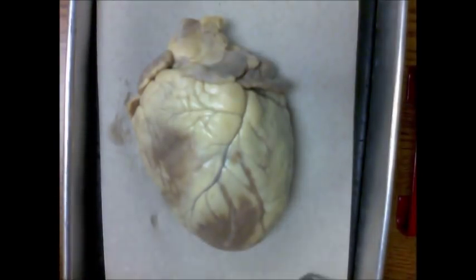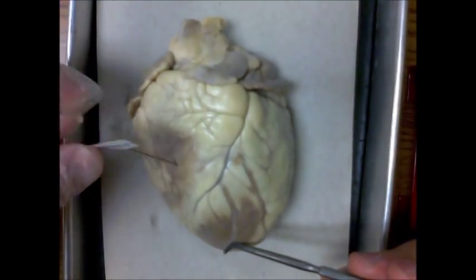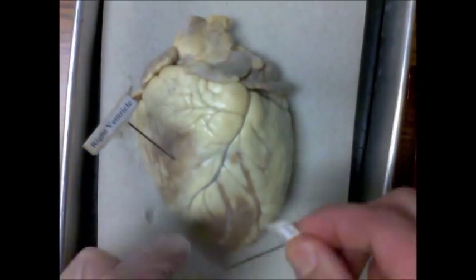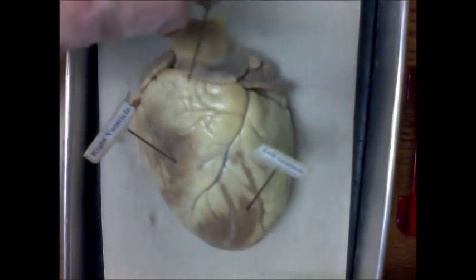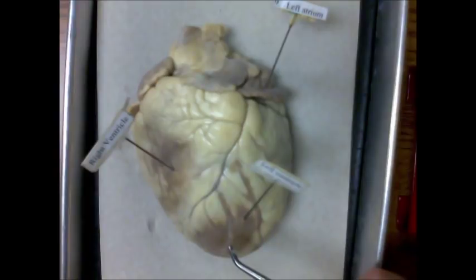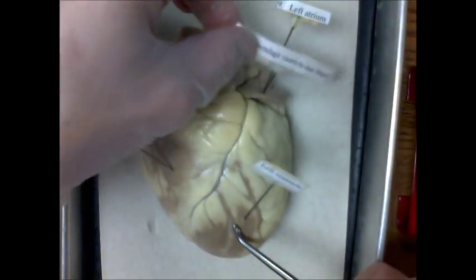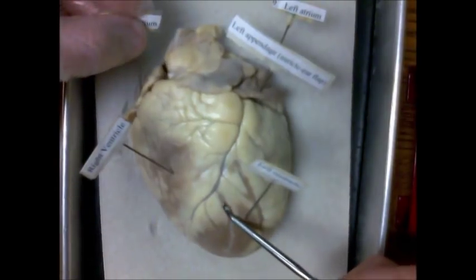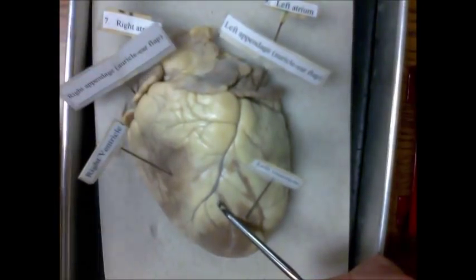Looking at the anterior structure, we have the right ventricle and left ventricle. The left atrium is inside the left appendage or auricle, which is the ear flap. The right atrium is inside that right auricle or ear flap.